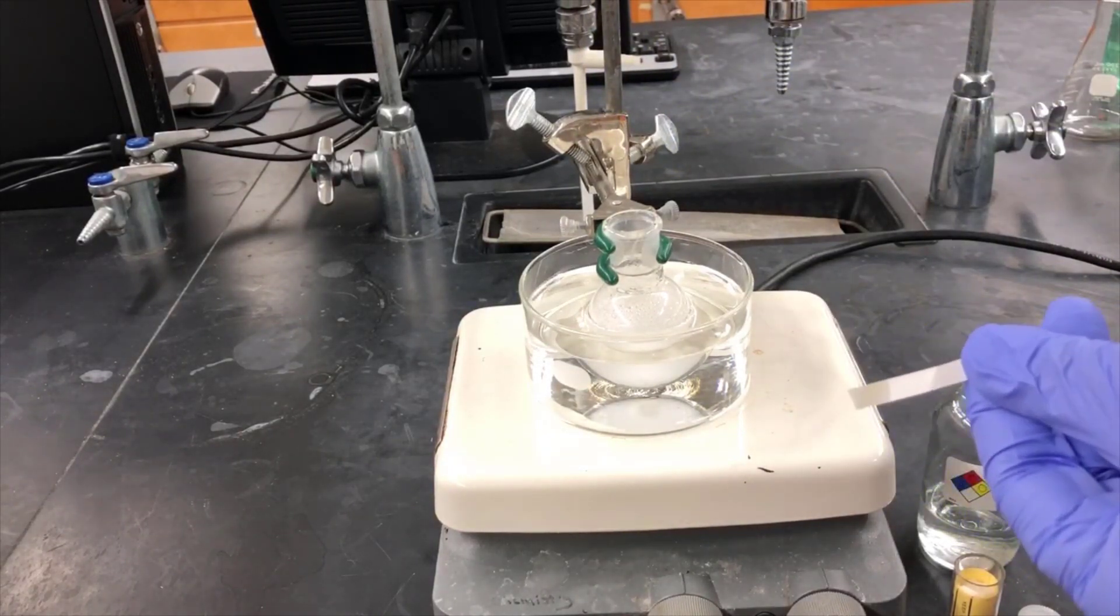There's no black color here, which means there's no hypochlorous acid present, so we're okay to go on to the next step.